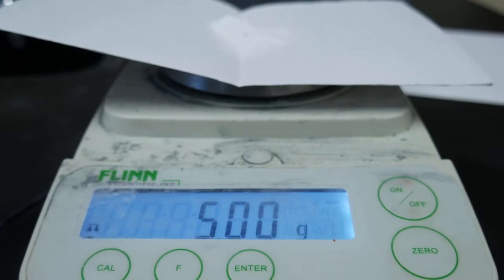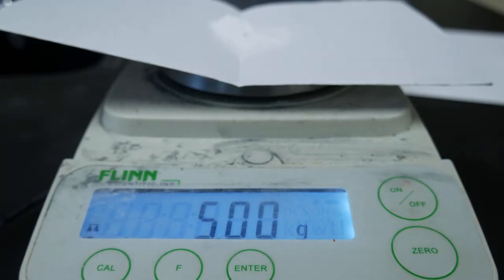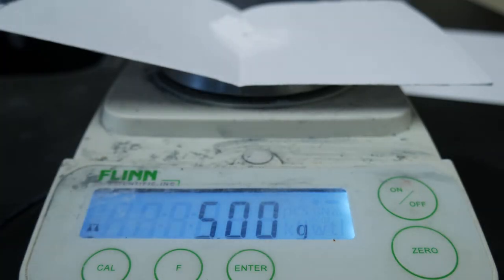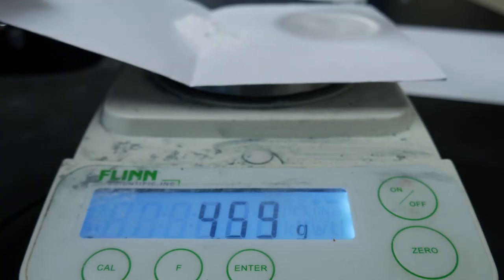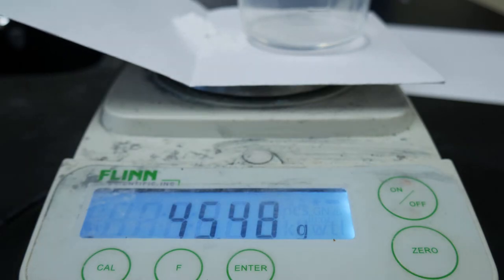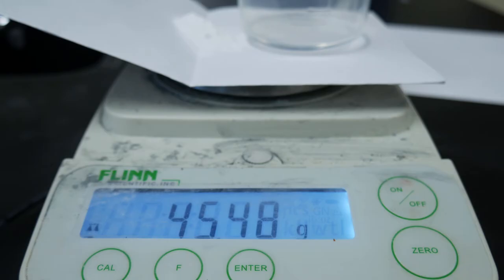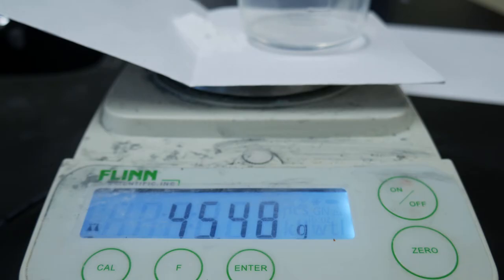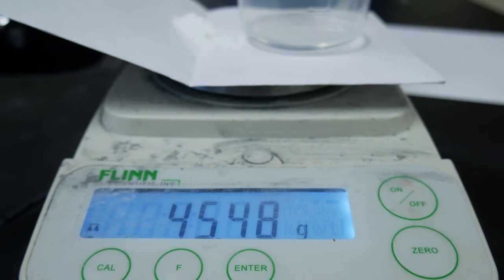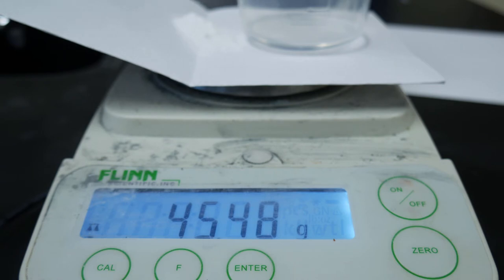Next, we're going to place the beaker and vinegar with our baking soda all on the scale and see what the total mass is of everything. It looks like we have 45.48 grams, so record that in the initial mass of our reactants column on your data table.